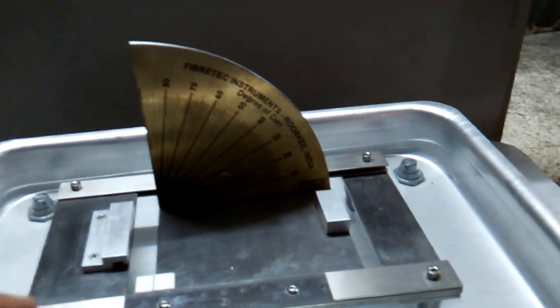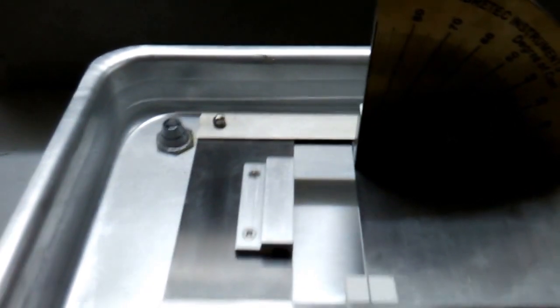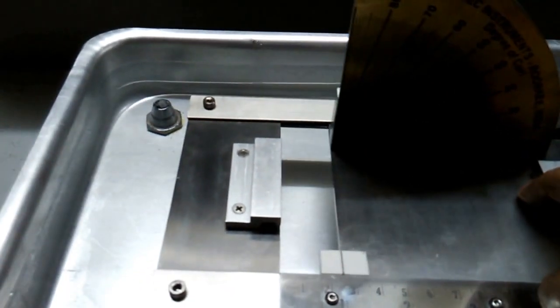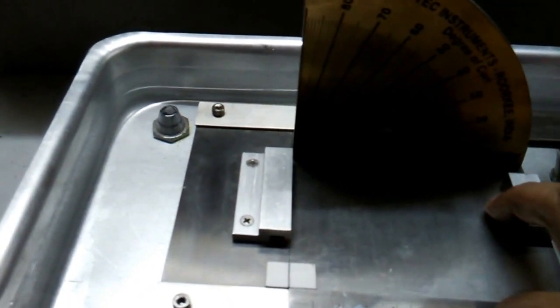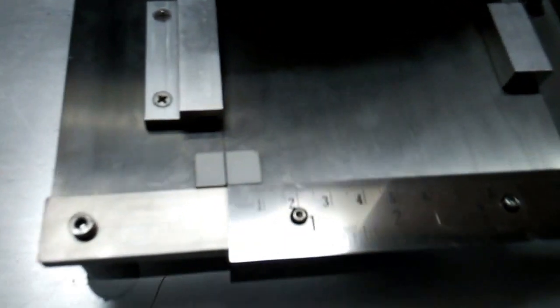This is the opening aperture. By sliding this, you can maintain the aperture of opening. This scale shows the mark as 0, and upon opening it you can see it goes up to 35 mm of aperture opening.